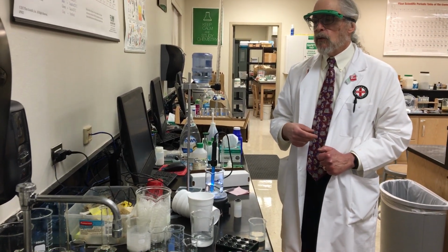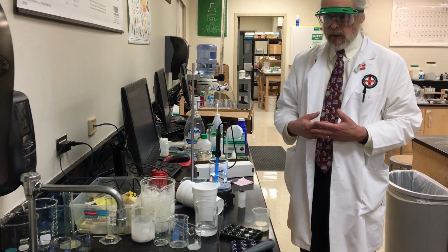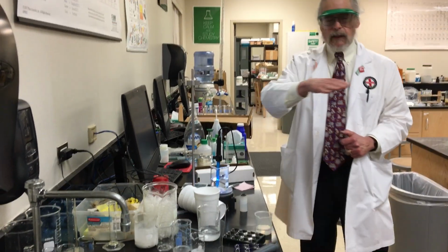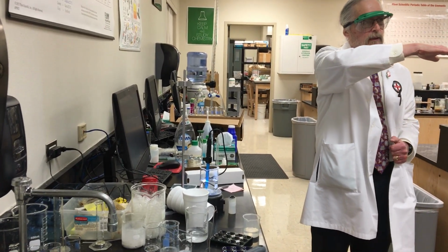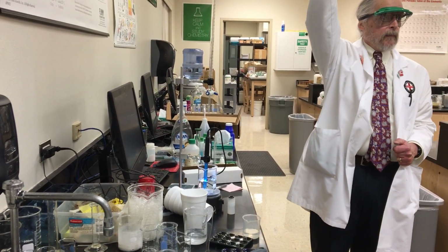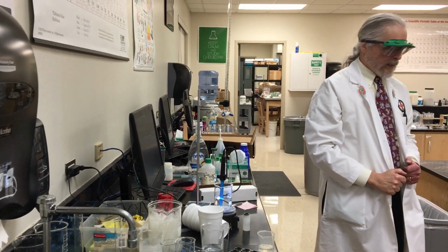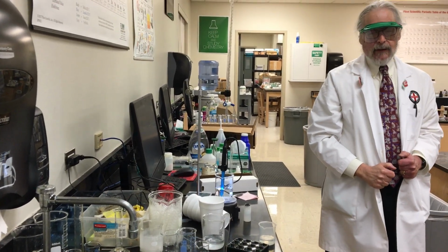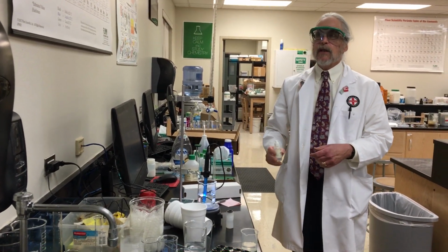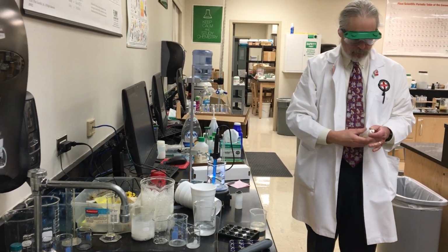How will I know when the moles of acid equal the moles of base? When pH is 7. The problem is, isn't my pH going to be real level and barely move, and barely move, and barely move, and then it's going to go boom? Be really careful. Yeah, but it's still relying on me to stop, because if I don't stop in time, the computer doesn't help me. I've gone past. Which is why you add an indicator.